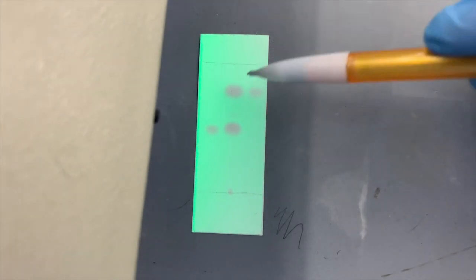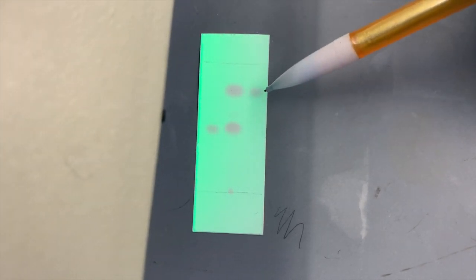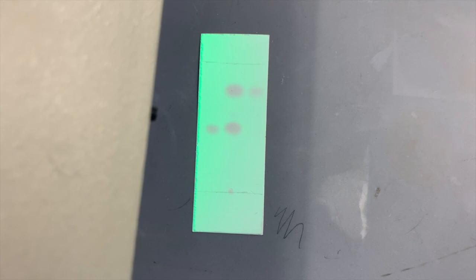Okay, our TLC plate has developed in the chamber, and now it is out. We are ready to visualize with the UV lamp. Take a look at that. Let's remember that the left side here, that spot is 2-naphthol. That was our reactant. The center here, this sample that now has 2 spots, that was the reaction after 1 hour of reacting, when we cooled down the mixture. And then finally, this spot right here on the right side, that is the material that we collected from the vacuum filtration.